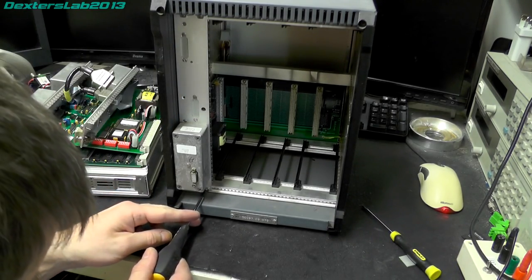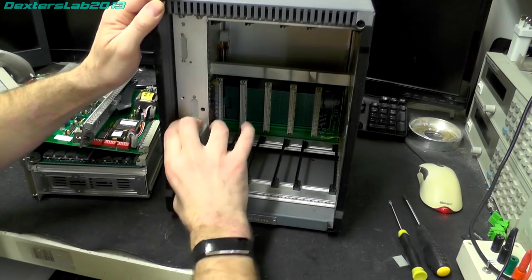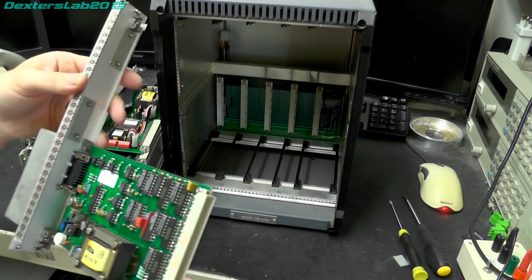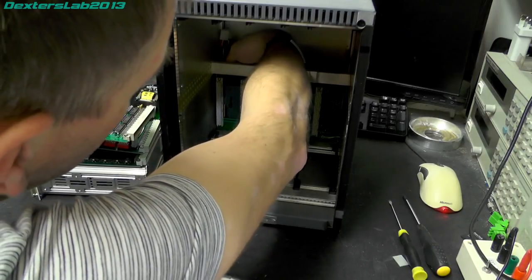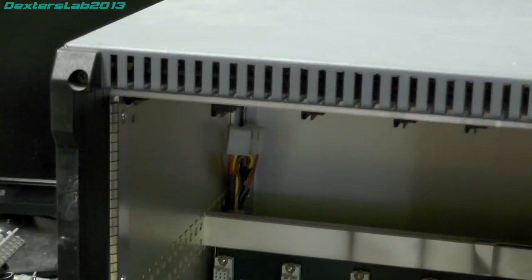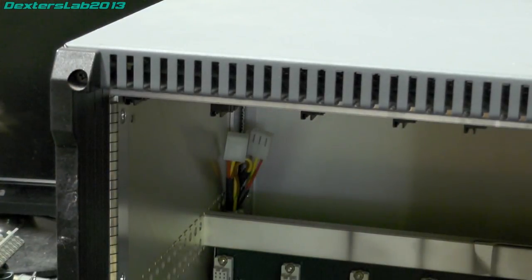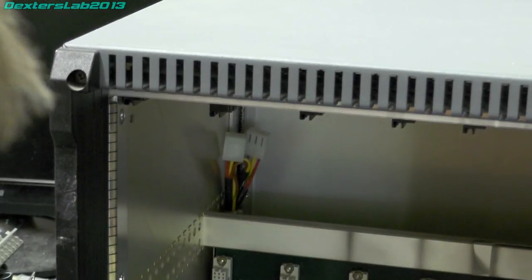And last card, yeah, it's definitely not a huge amount in here. So we have a small card here, transformer on it. Actually, the other one did as well, didn't it? So yeah, another card. So yeah, there's nothing else left in there now. There's a couple of connectors up at the back there, which don't seem to be attached to anything at all. They're literally just looped and cable tied. These cables here, it's literally just a loop of cable and it's been cable tied to the front there. So that's obviously some kind of spare or accessory cable or something that's not used. And there's nothing on the back of the backplane, nothing there. So that's literally just an interconnection there.